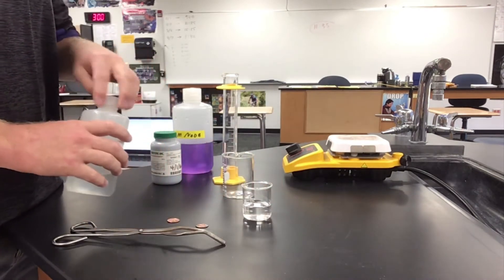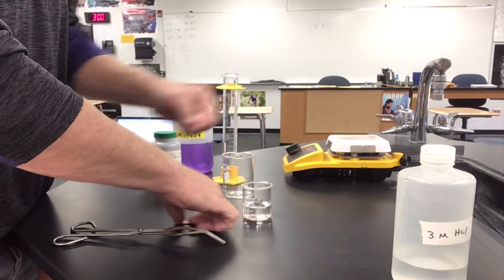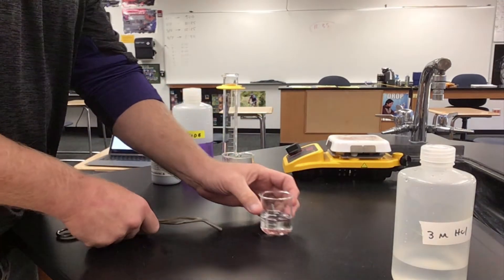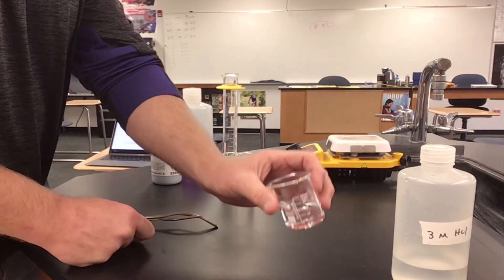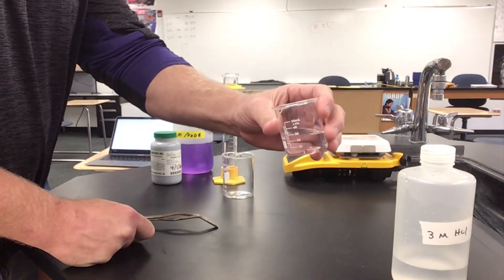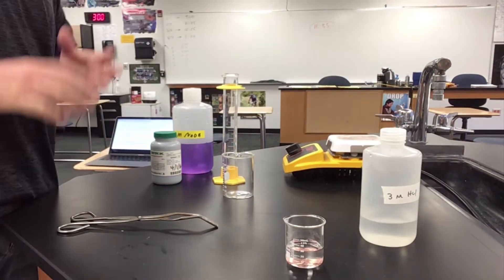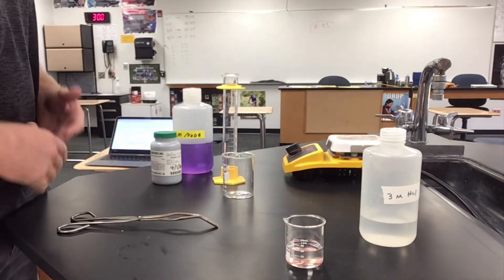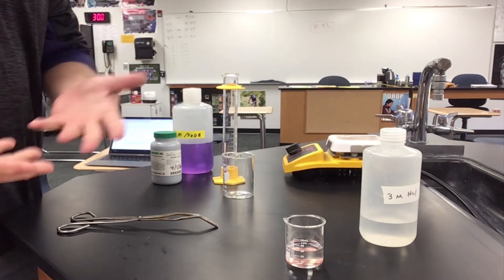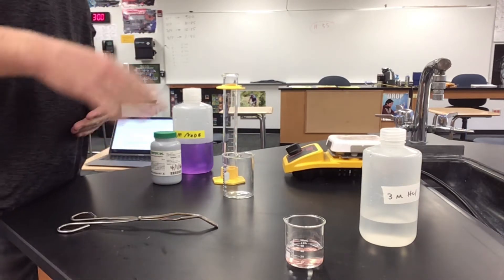I'm going to place both my pennies into the acid to allow the acid bath to clean those pennies. Any material on the pennies that would make them dirty — the acid is now cleaning that for me. I'm going to set a three minute timer, and in three minutes I'm going to take those pennies out and rinse them off.